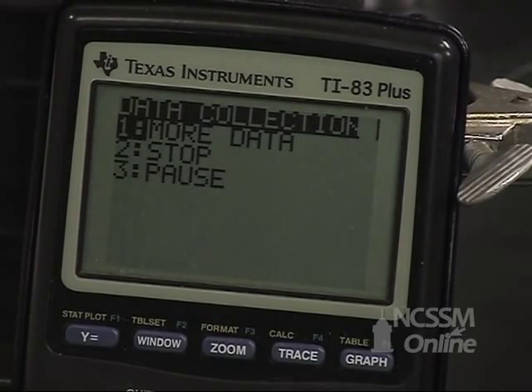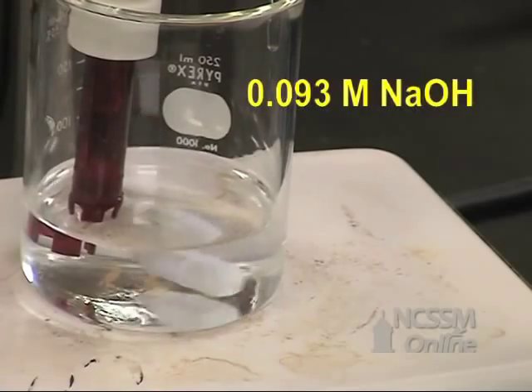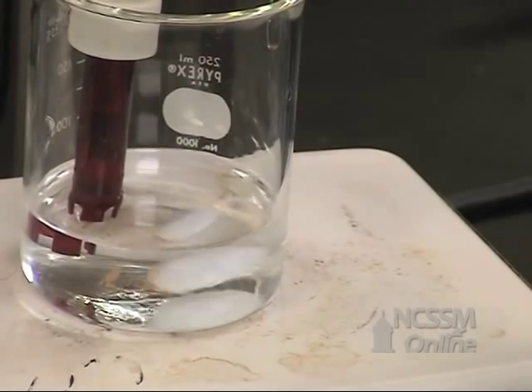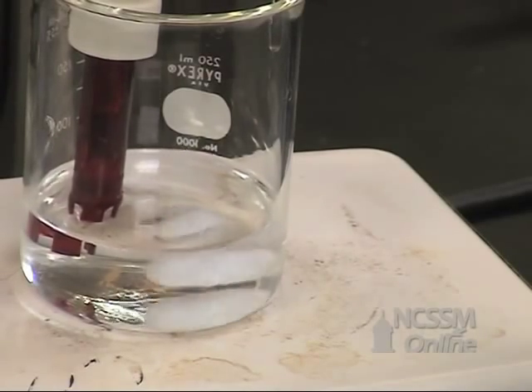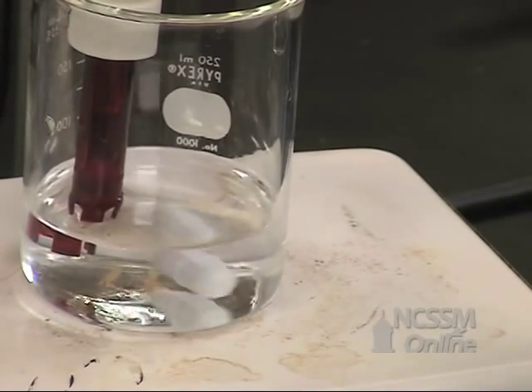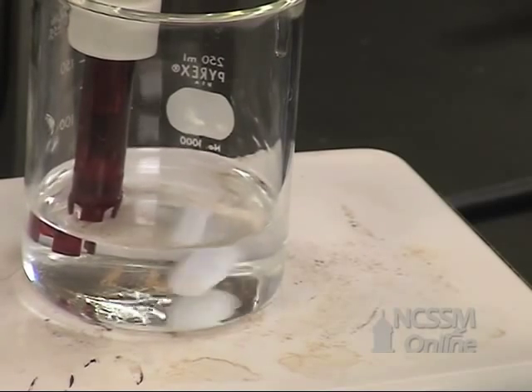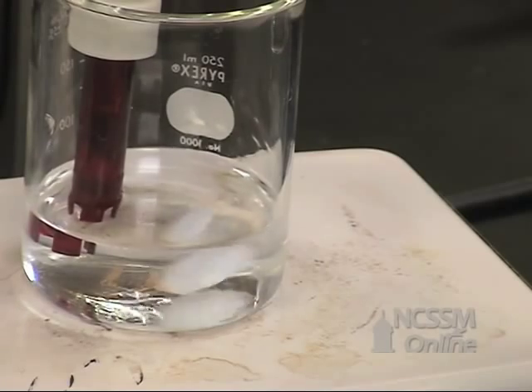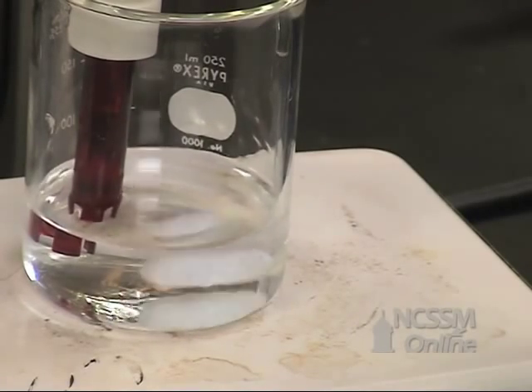We want to collect more data. You're going to add the sodium hydroxide solution in 1 milliliter increments, collecting data each time. Remember that you also want to include in your titration the volumes for the first half equivalence, first equivalence, second half equivalence, second equivalence, third half equivalence, and third equivalence points in your data.